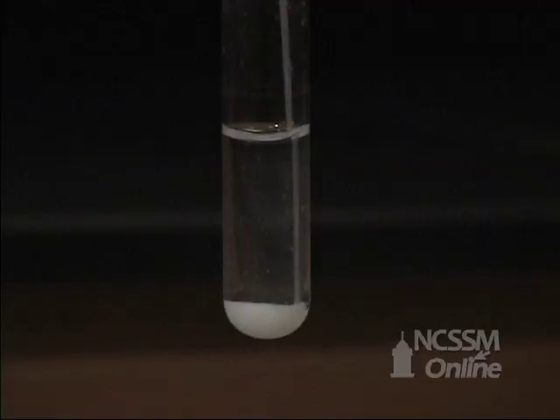carbon dioxide forms carbonic acid, which reacts with the calcium hydroxide to form calcium carbonate. The calcium carbonate is not very water soluble and settles to the bottom of the test tube.